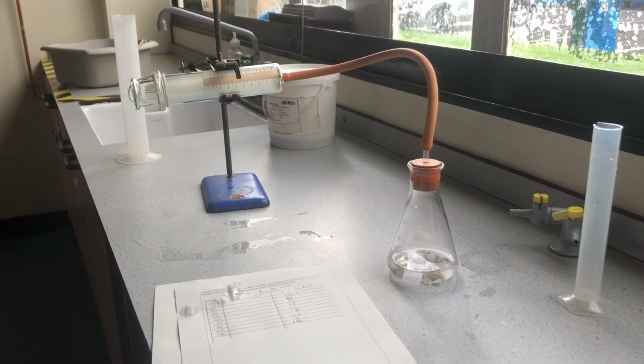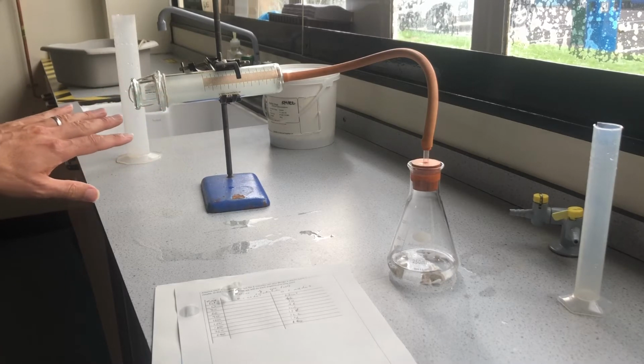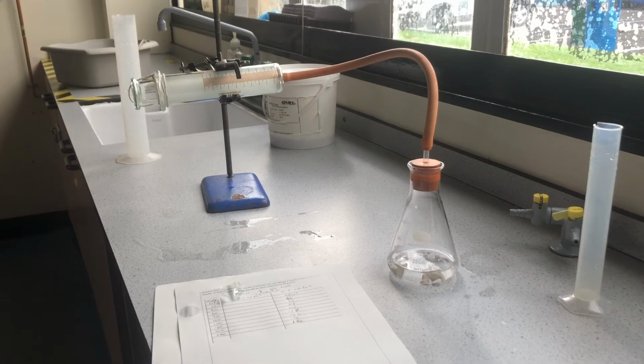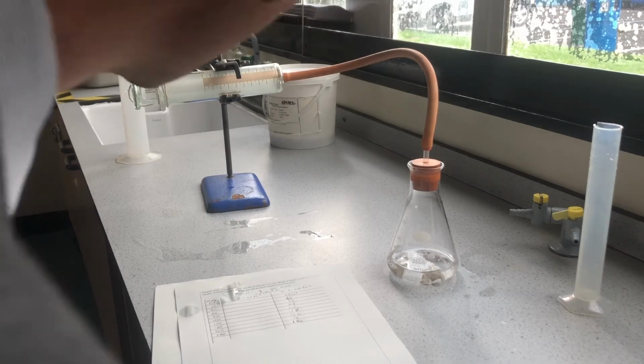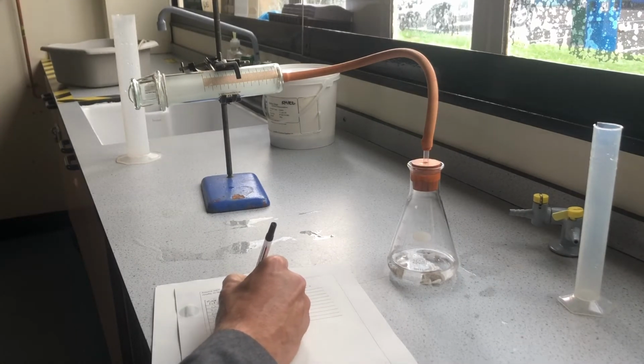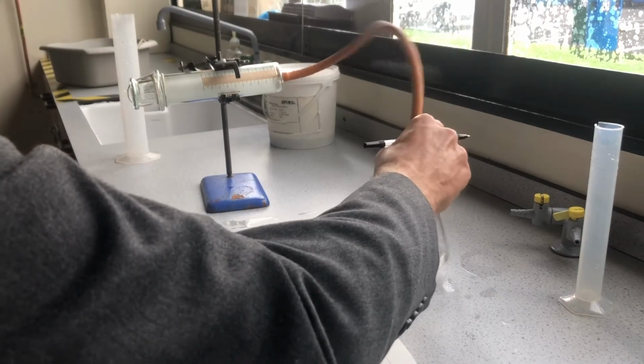The other thing about using a more dilute acid with fewer acid particles is we will get less gas produced at the end because there's fewer particles hanging around. And that's one of the reasons I can use the gas syringe. The gas syringe will measure up to 100 centimetre cubed of gas, and in the last experiment we produced far more than that. So first 30 seconds, it's about 3 centimetre cubed of gas. Okay, give it a stir again.